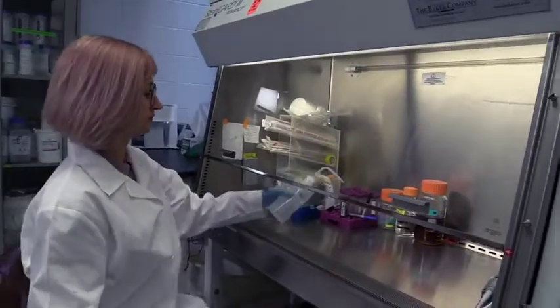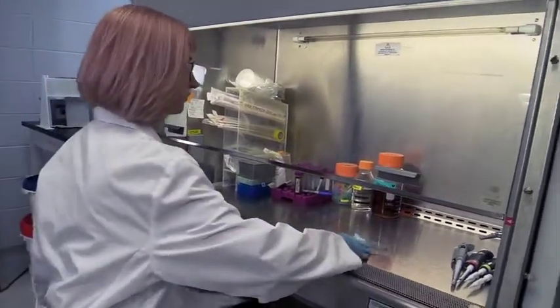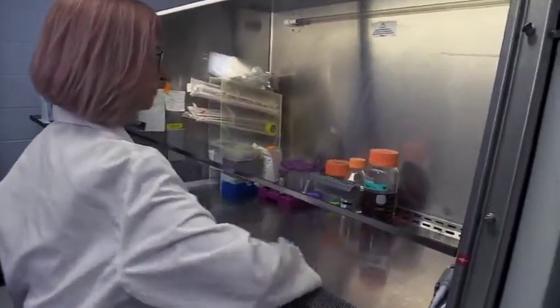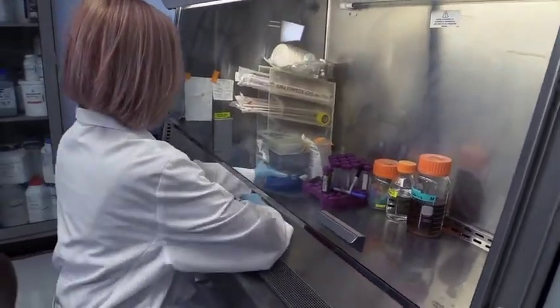So Rachel, what are some do's and don'ts that you'd want to make sure people aren't doing or are doing in these different levels? Sure, and a lot of that would be personal practices, including PPE. So it starts from the very basic level, which would just be establishing good habits of washing your hands and cleaning up spills, and then at the higher levels, we would ask people to wear additional PPE.